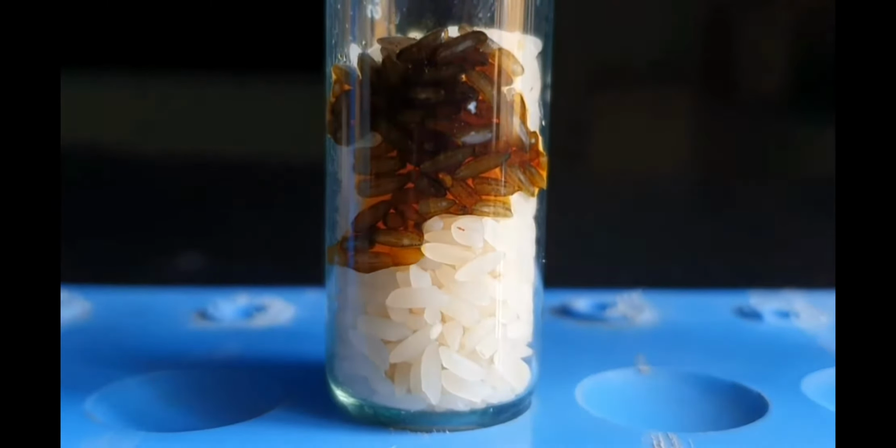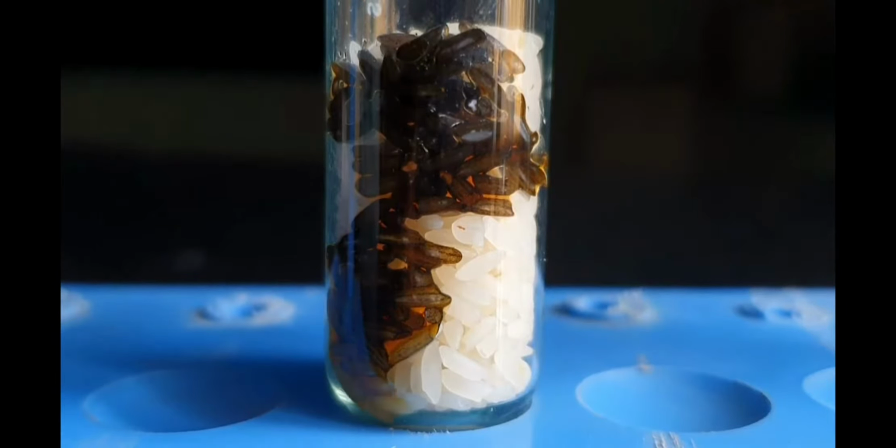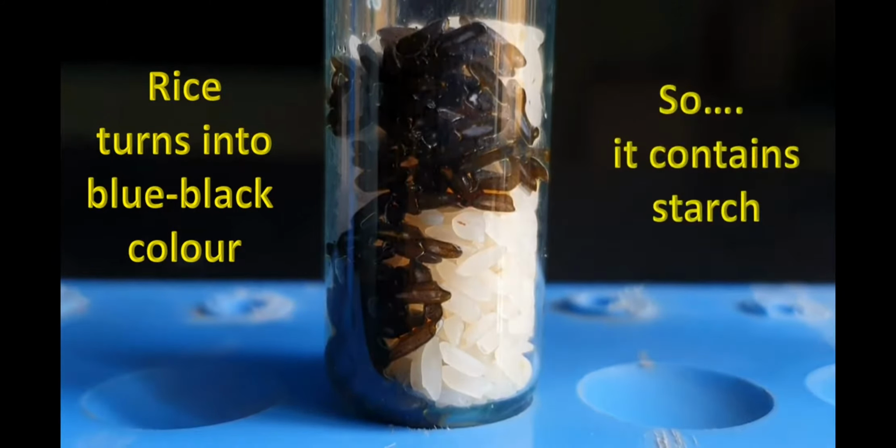If it turns blue and black color, then it indicates the presence of carbohydrate or starch. So the rice turns blue and black color, so it contains starch.